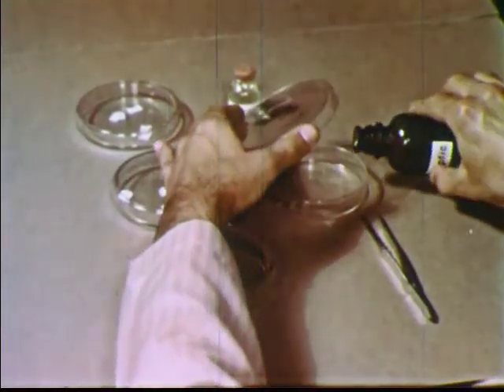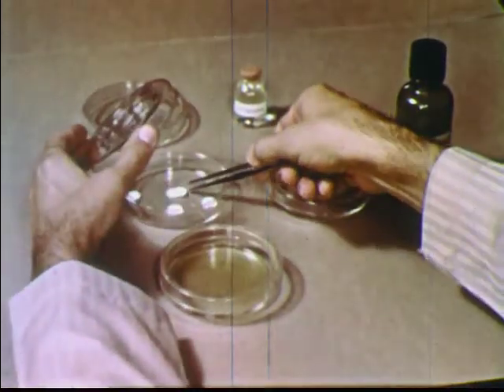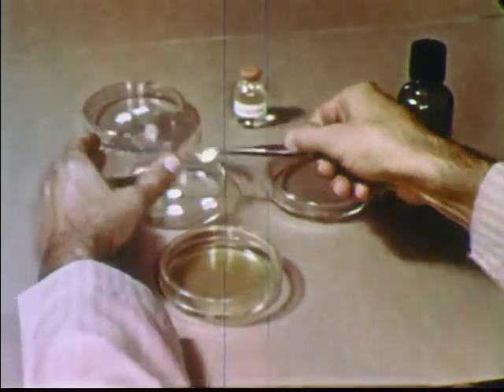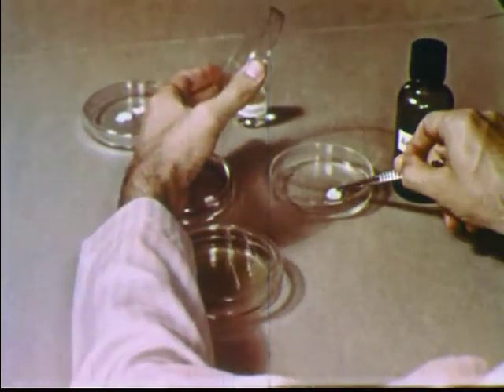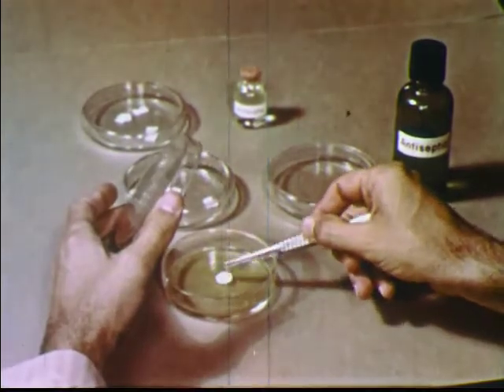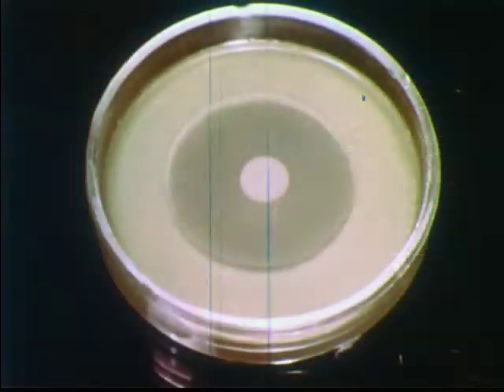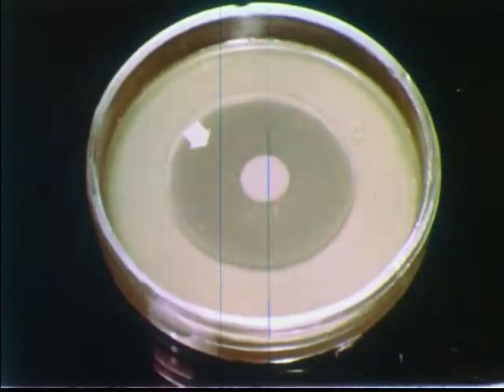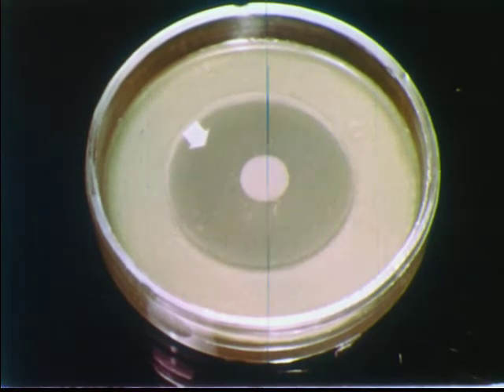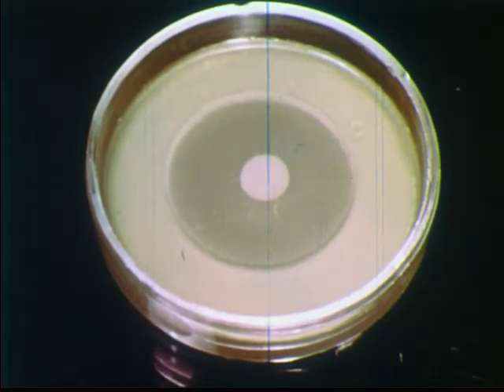Chemical antiseptics also effectively control the growth of many bacteria. A filter paper disc is soaked in a common antiseptic and placed on growth material that has been inoculated with a large number of bacteria. After incubation, the clear area around the disc indicates killing of the bacteria which came in contact with the antiseptic.